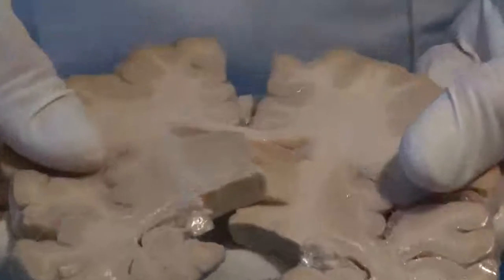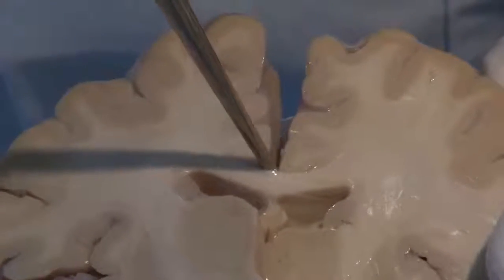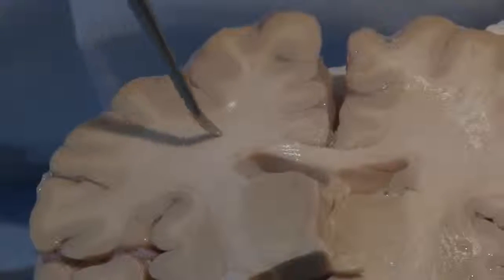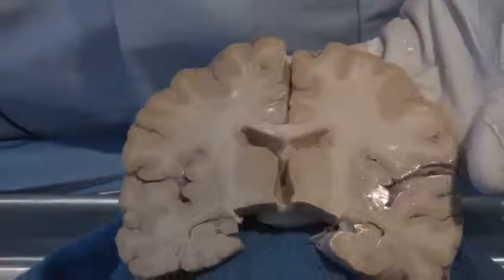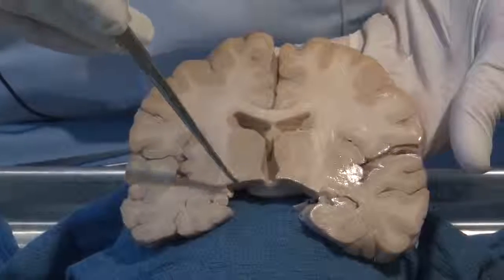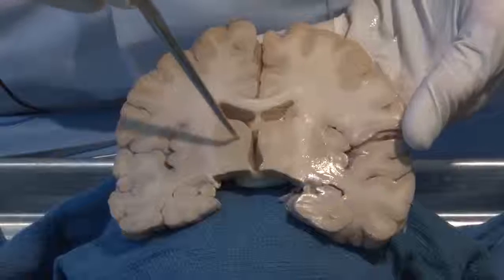It was that band that held the two hemispheres together. When we were looking down through that interhemispheric fissure, at the base of that was this band of white matter connecting similar areas or homotopic areas of one hemisphere with the other. And this is a way that the right and the left hemispheres can communicate. In addition, they can communicate through structures like this deep area. You notice it's beige, so it's mainly cell bodies. A deep structure called the thalamus.